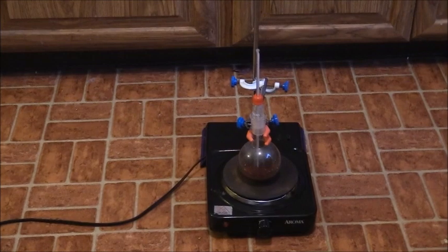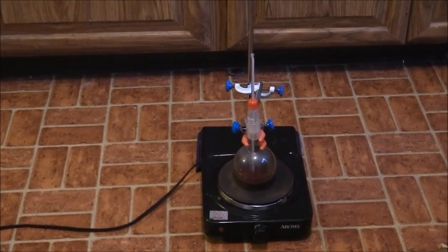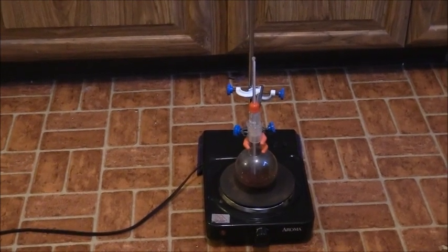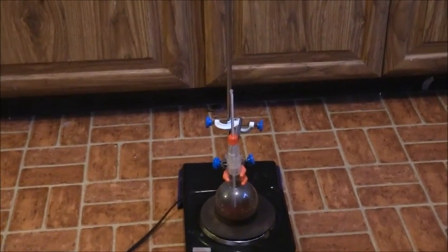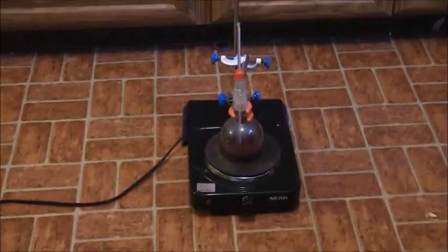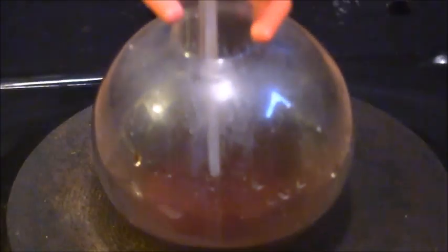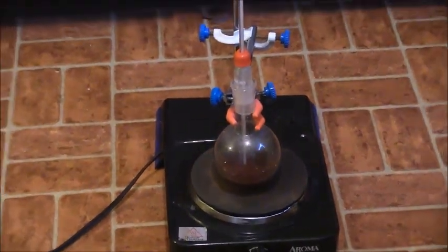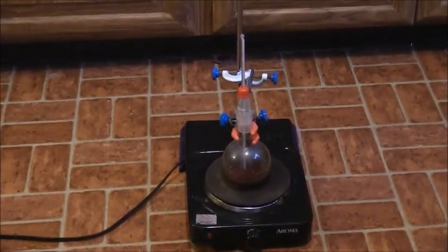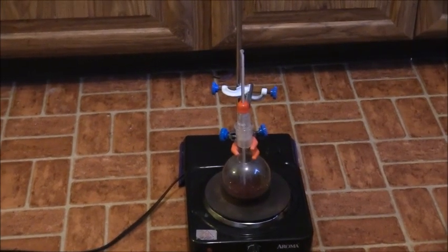So I checked my experiment at the 36 hour mark. And rather than the colorless solution I started with, I now have this reddish brown solution. As you can see there, solution is now reddish brown. And I have my ideas about why that is. When you convert formamide into purines, the intermediate step is to produce hydrogen cyanide.